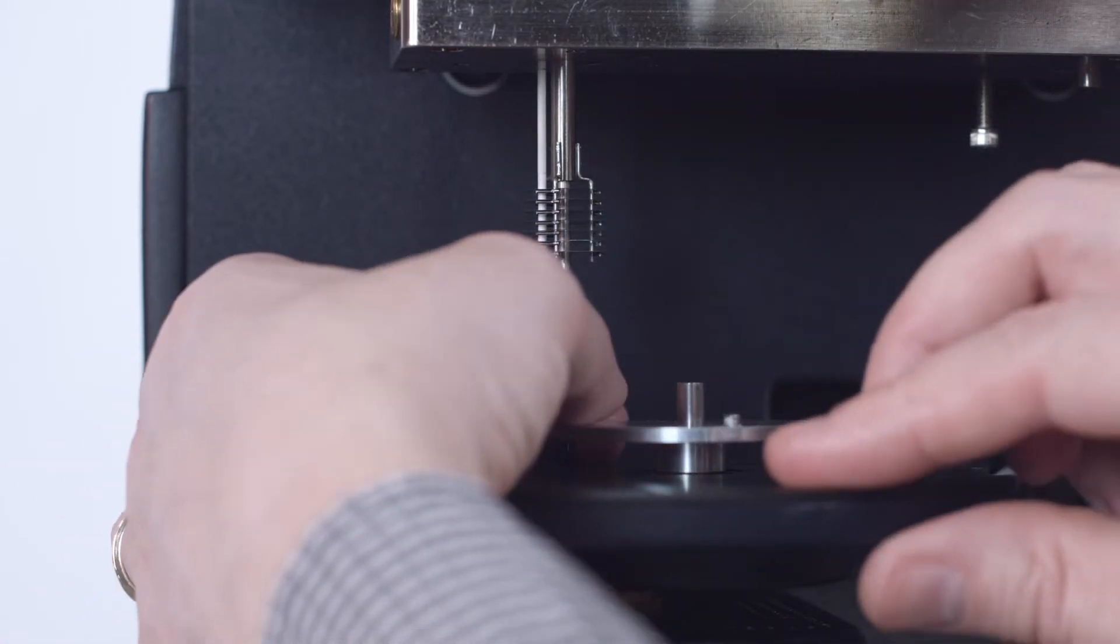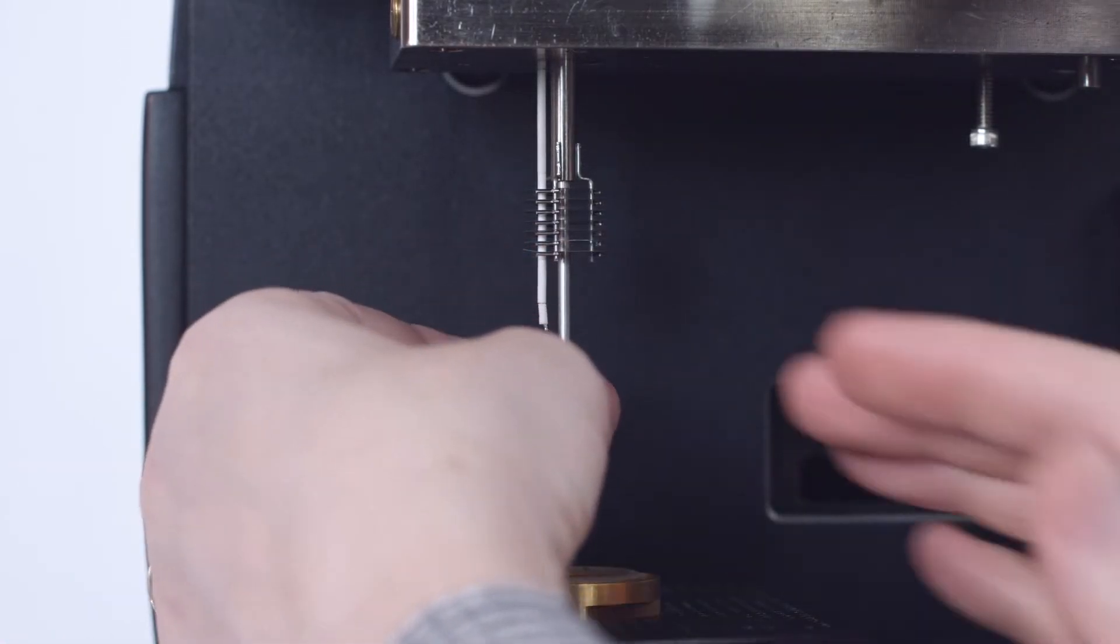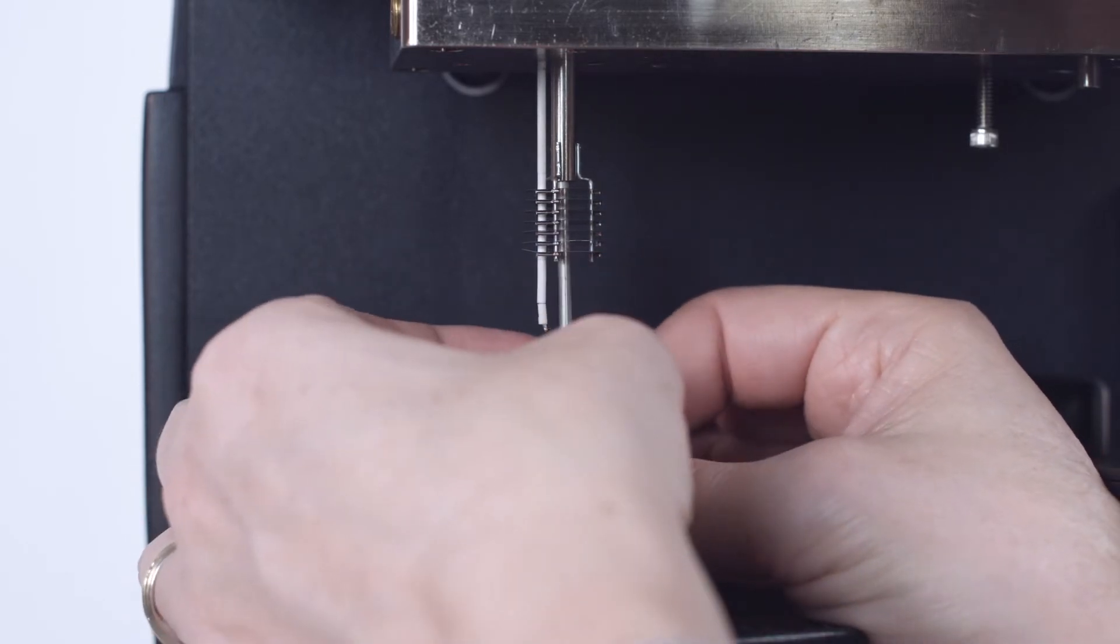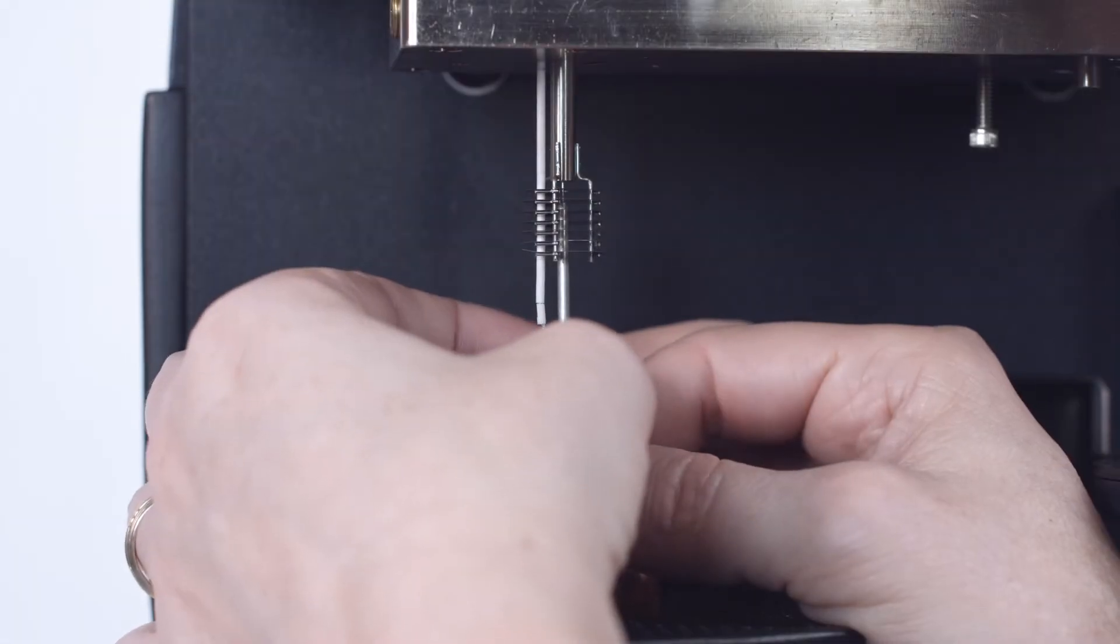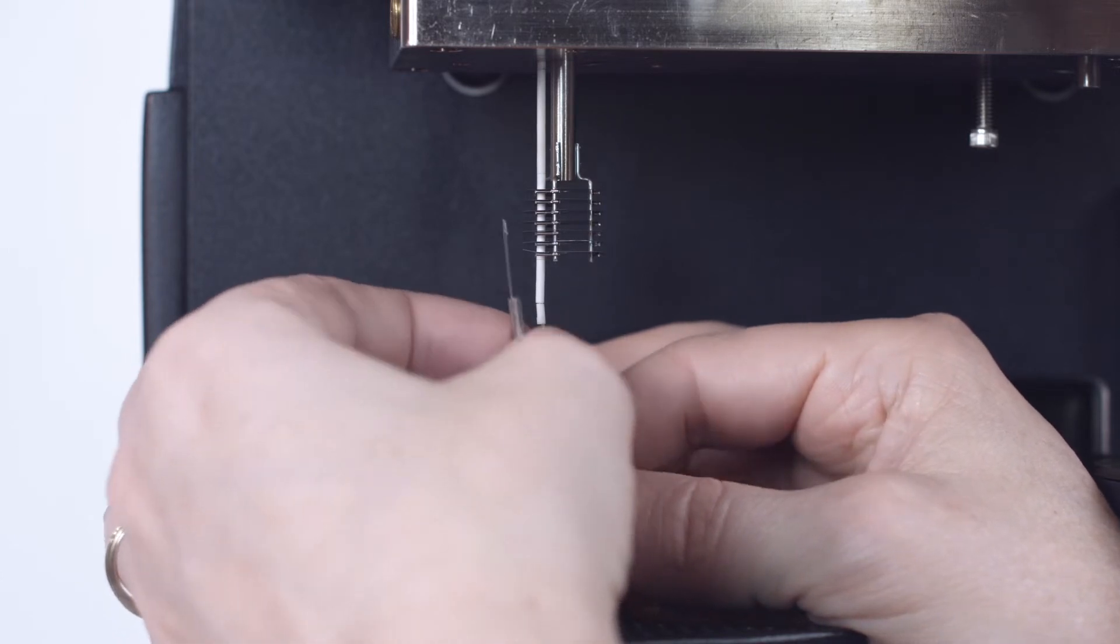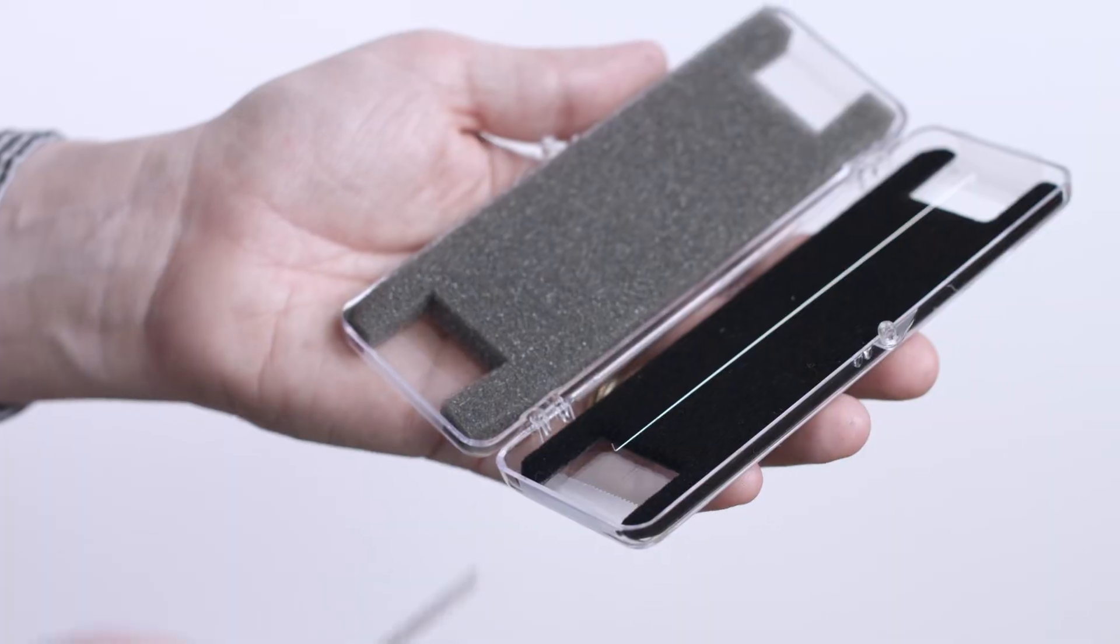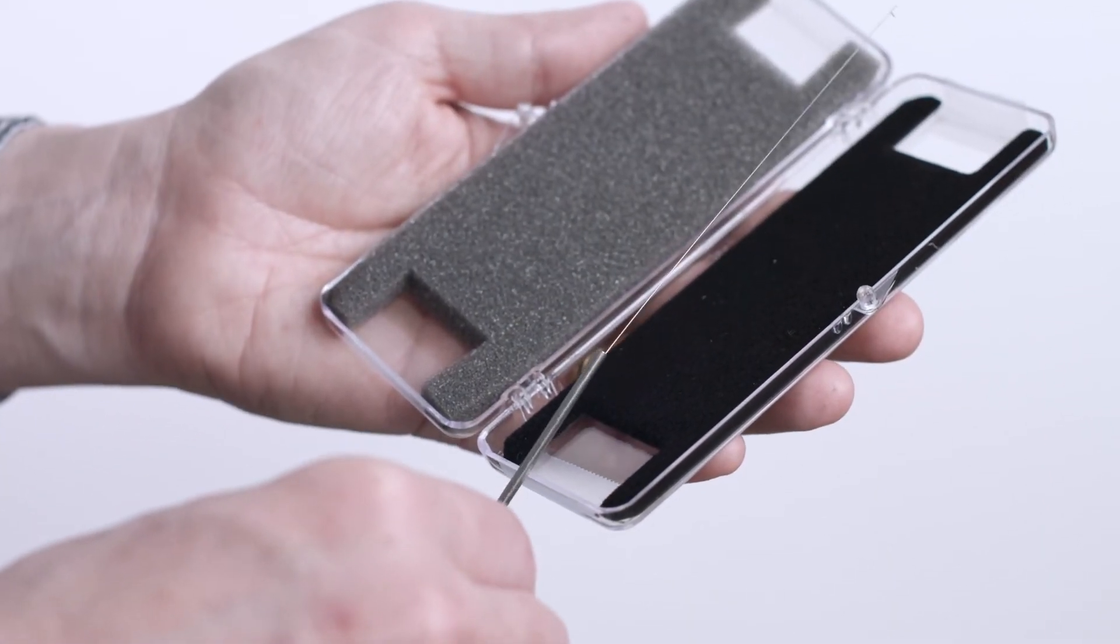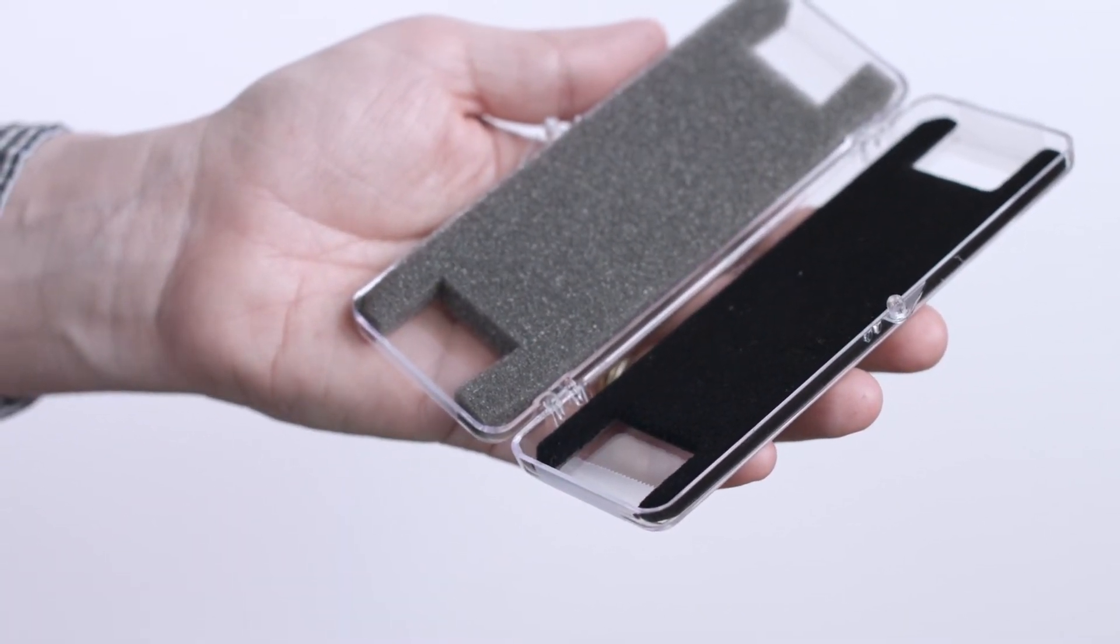Rotate the auto sampler tray away from the tool and slowly lower the tool until it and the hang down wire clear of the upper furnace assembly. Using the tool, pick up the new hang down wire from its case.